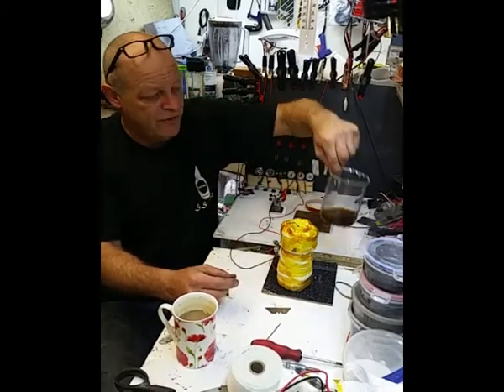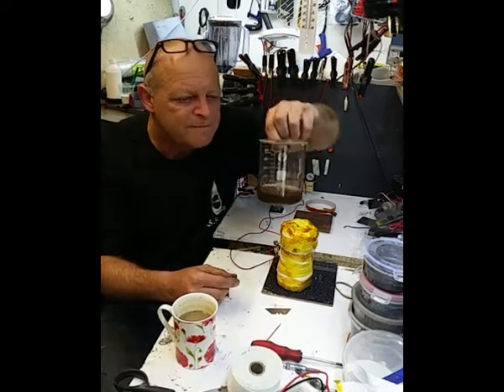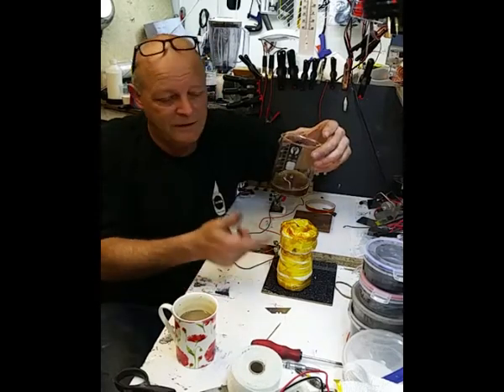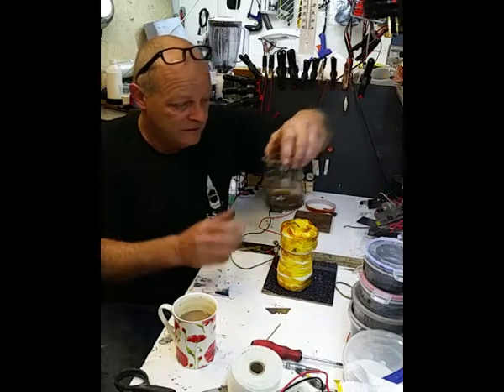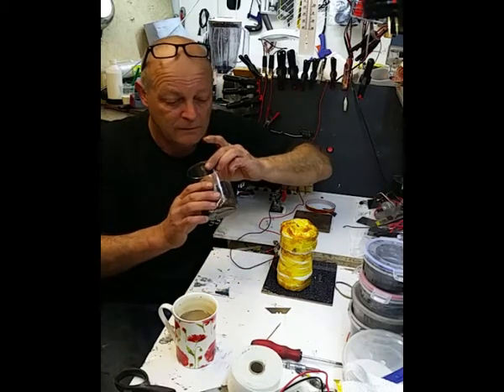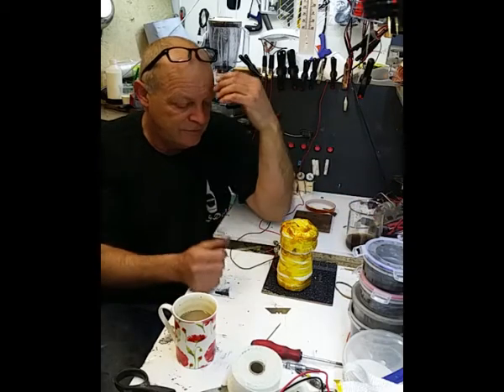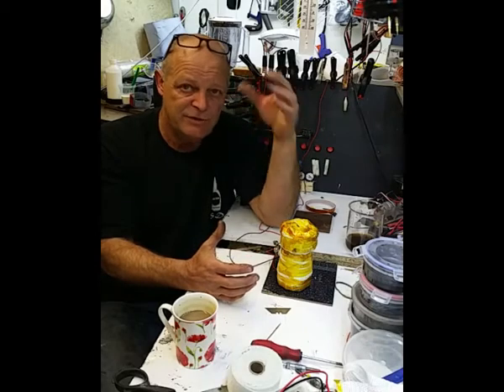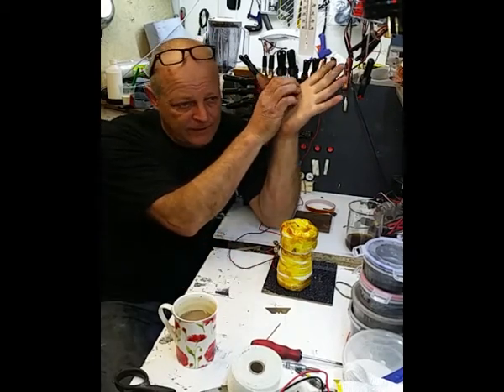I did take the mixture out. I did test that to see if it was rust, and it's not rust. And yes, it does stink of seaweed. I carbonised seaweed in that last, so that's why it's that colour. I've got some seaweed carbon in there. So what I'm going to do is try this again now, and we'll see what the temperature gets up to for the amount of current that we need.